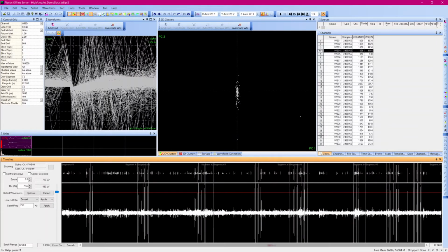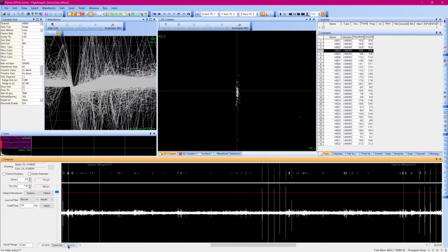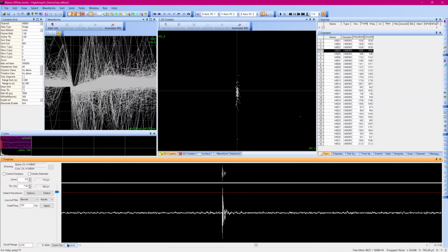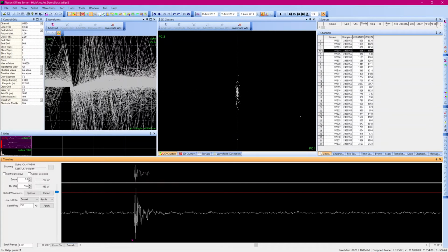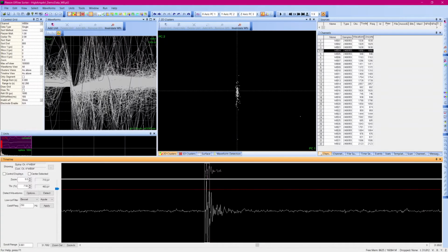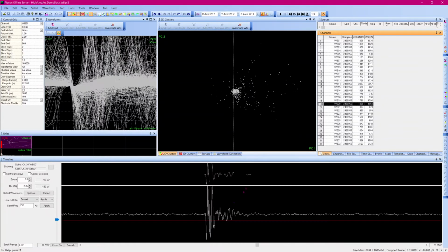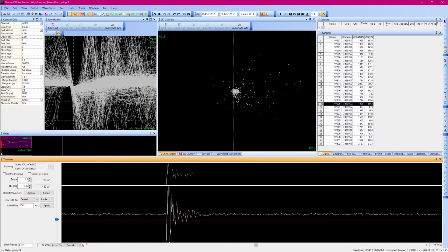Looking across several channels, it appears many of the artifacts are above 500 microvolts, and all of the data are well below this value. If we zoom in on the timescale, we can see these artifacts have a high amplitude peak and then oscillate before returning to baseline. Looking even closer at one of these oscillation periods, we can see that at least 3 waveforms were defined from this artifact. In a different channel, the artifact creates 5 to 6 waveforms. Exploring across channels and occurrences of the artifact, we see a variation across the length, but we know there are roughly 3 to 6 spurious waveforms defined from each occurrence of the artifact.